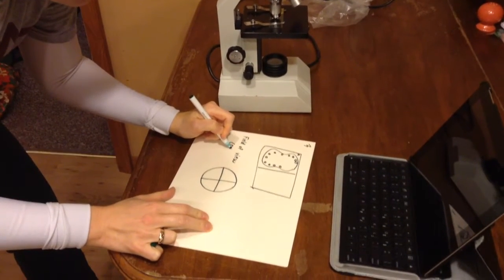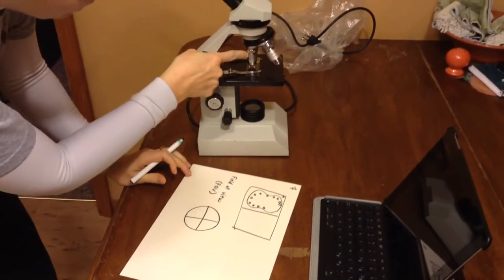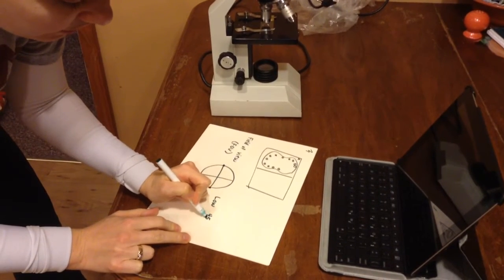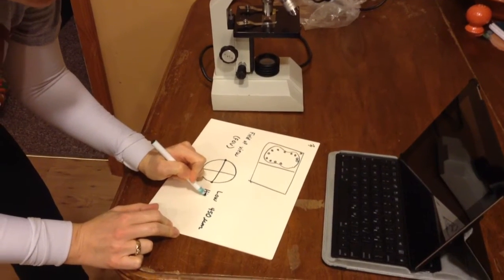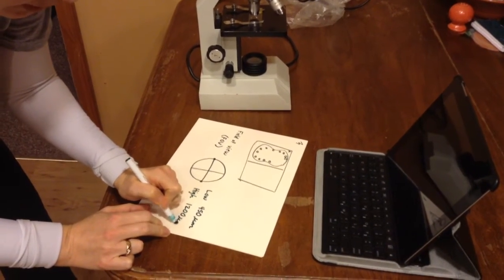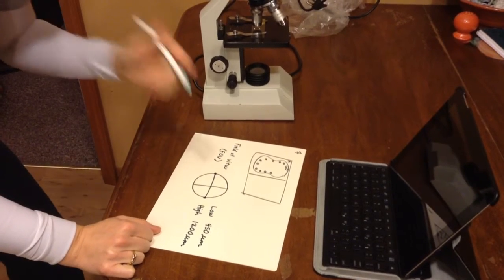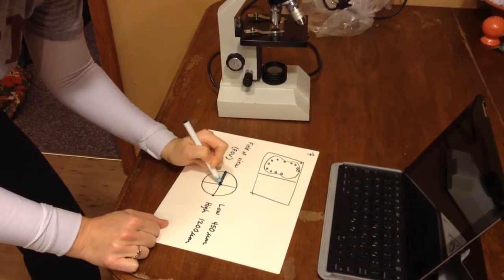or FOV. Now for the low power lens, which remember was that medium-sized objective, the field of view, or the distance for the diameter of what you're seeing, is 450 micrometers, or UMs. Under high power, the size of that circle of light that you see, or the high field of view, is 1200 micrometers. So that's the first step in what you have to know to find the size of one of these cells. The next thing you have to do is you have to imagine that you've stacked those cells side by side, end to end, across your field of view.